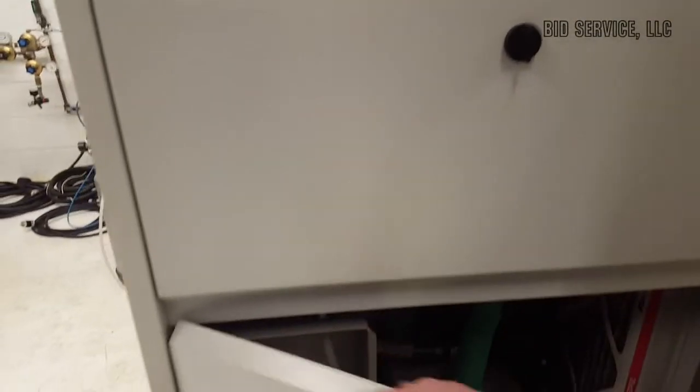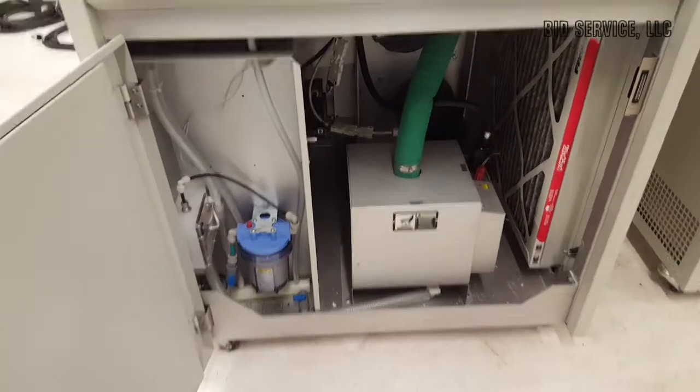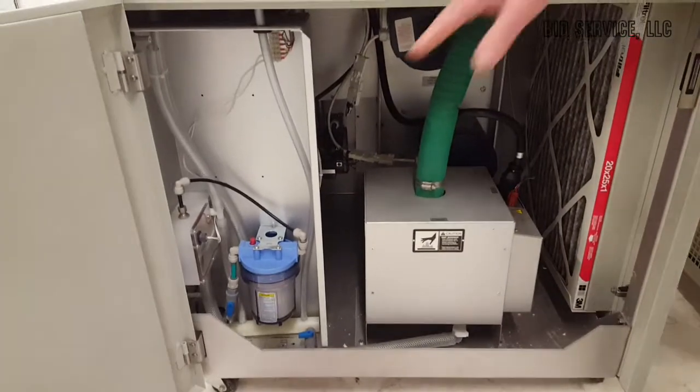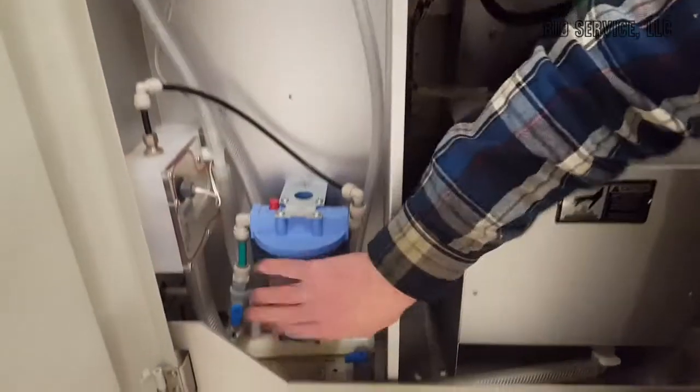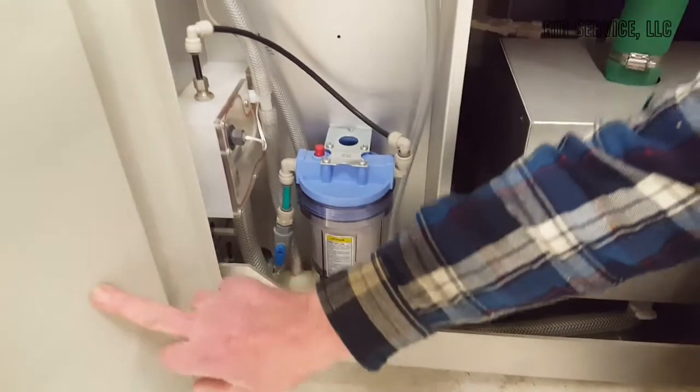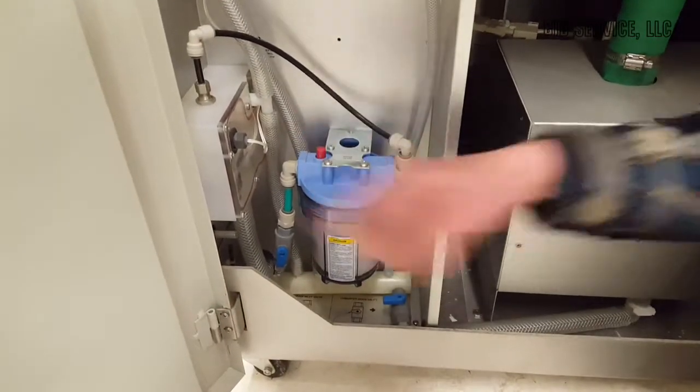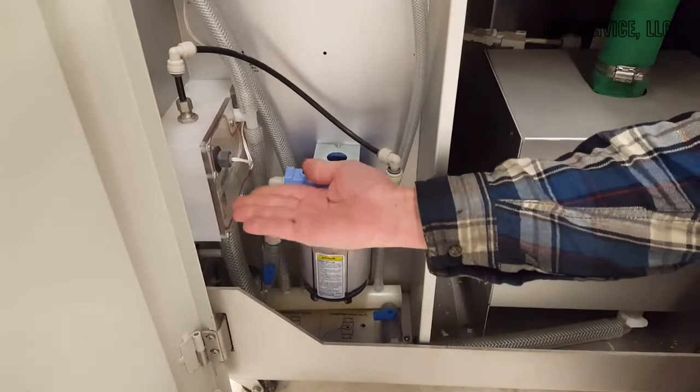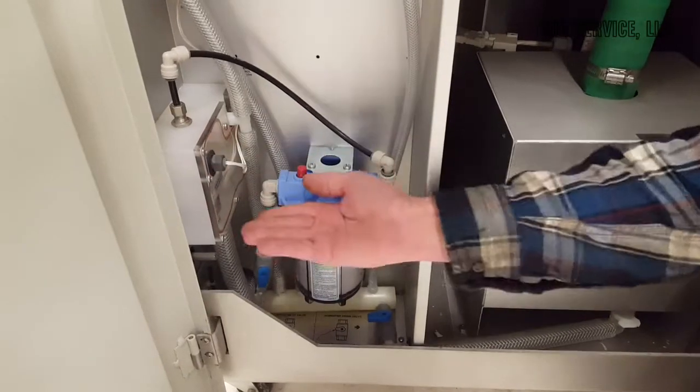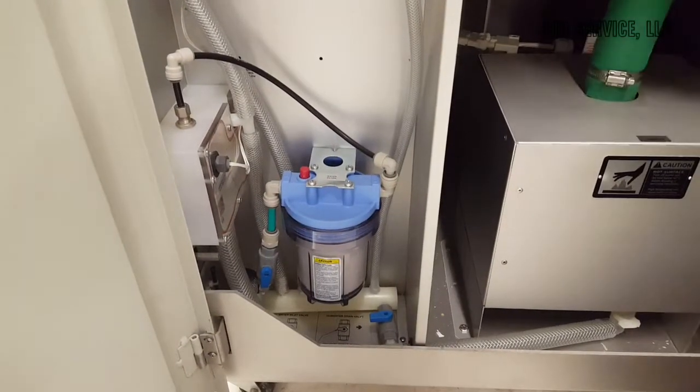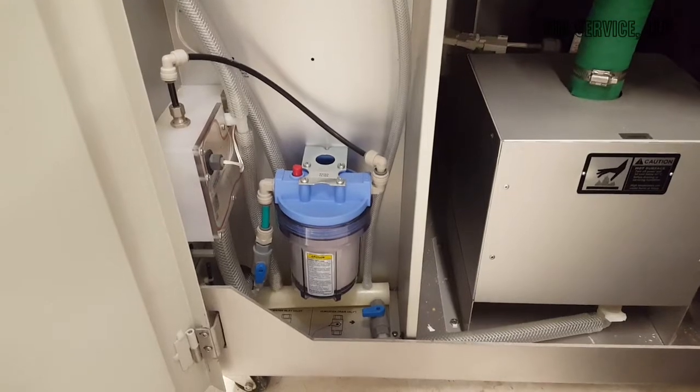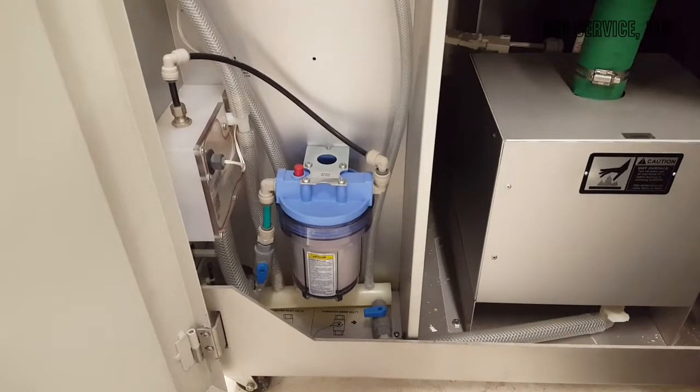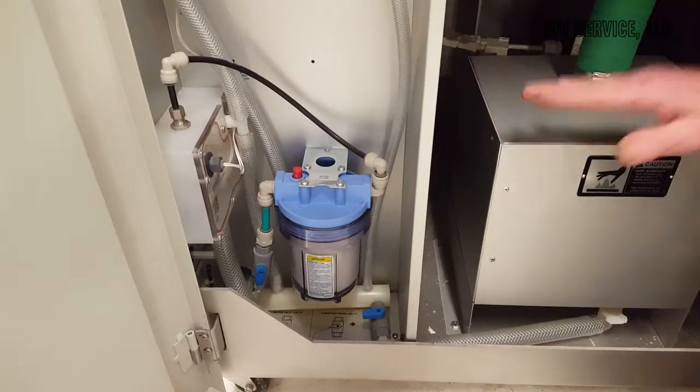Also, on the bottom here, this is a filter that periodically should be cleaned. We're leaving you with a clean filter. This would also be where the water would come in through the back into a float control here, so that as long as there's between 70 and 90 psi of water pressure, it'll keep the system filled.